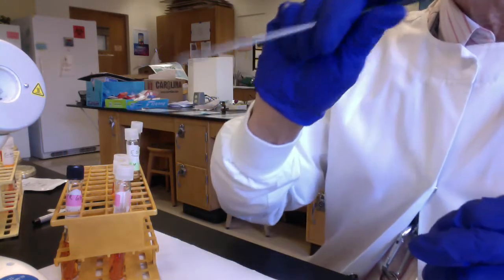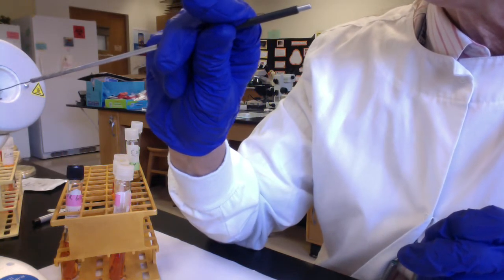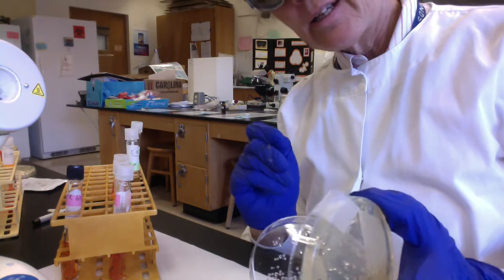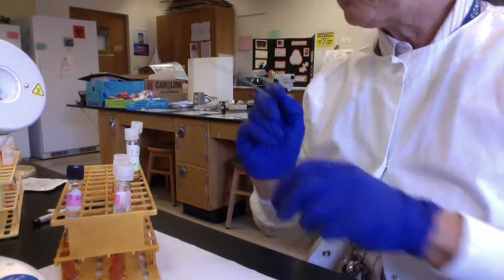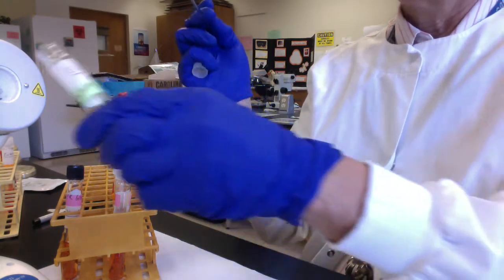Because we want to maintain that anaerobic zone there. So again, just really quick, we'll sterilize my loop. I'll open my pure culture plate of E. coli, touch the agar to make sure my loop's not too hot. And then all I have to do is just barely touch where the E. coli is growing, just get a little bit on my loop. And then, this is getting repetitive, right? Warm the cap, warm the lips.